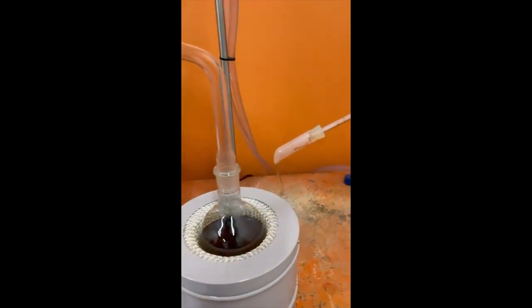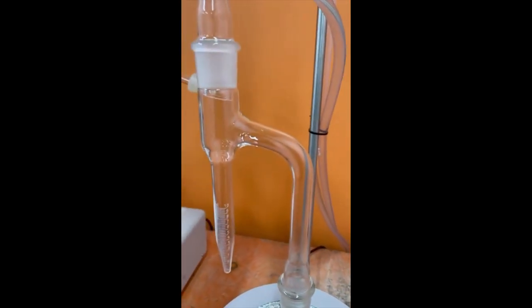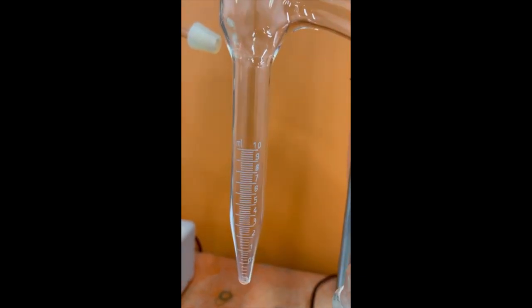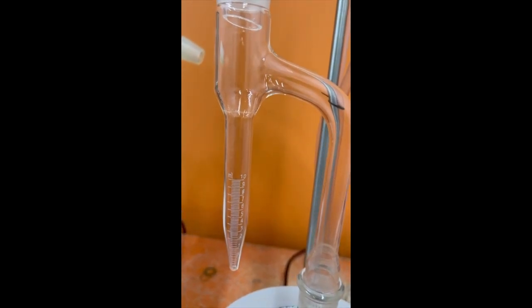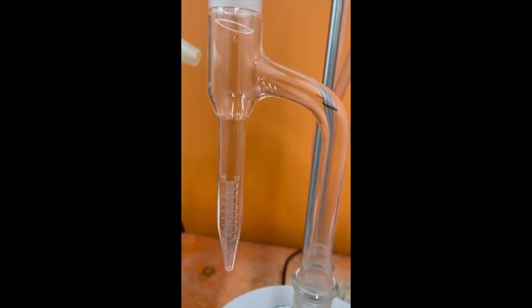This is a receiver for the water trap. We did calibration. Already we've done the calibration. I used a micro-burette. It is traceable to 0.01 milliliters.